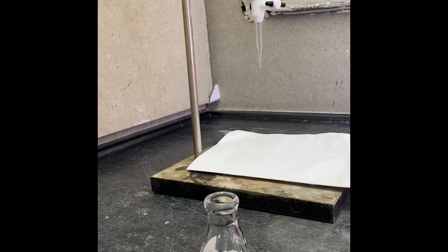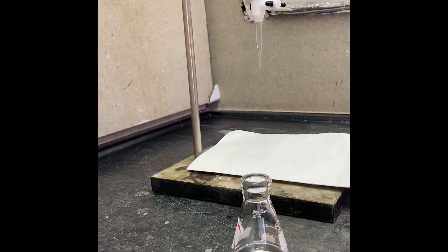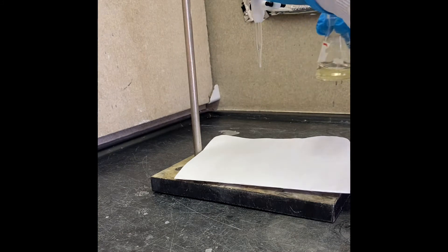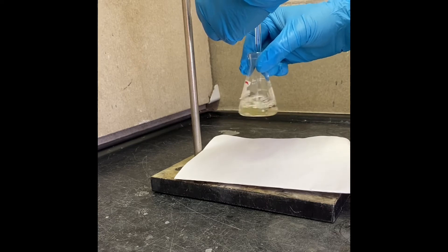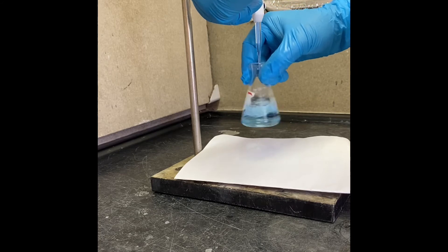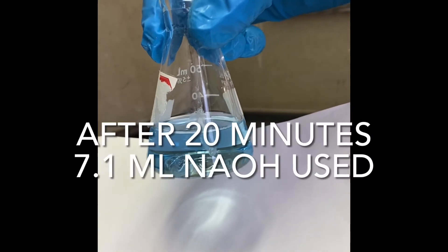It's been 20 minutes. I'm preparing my second solution — I have 10 ml of reaction mixture, 10 ml of acetone, and three drops of indicator. Again at initial, as you can see, it's yellow. Now we're going to do titration with sodium hydroxide — each time make sure you're reading the number on the burette. The color did not change after 20 seconds, so that's the second titration.